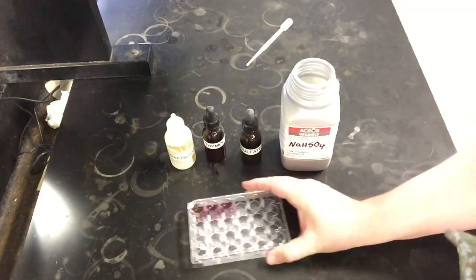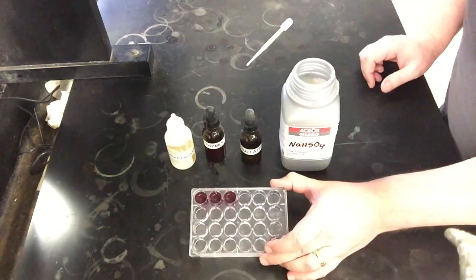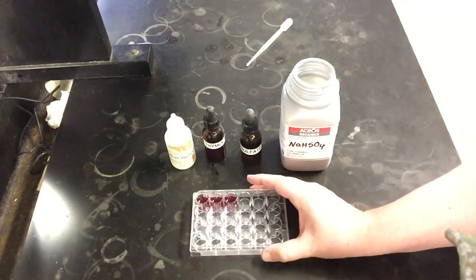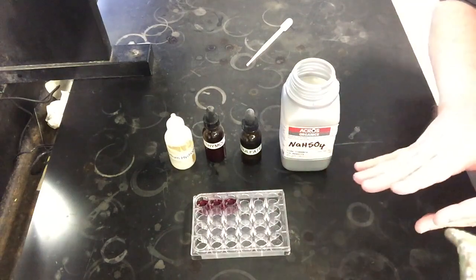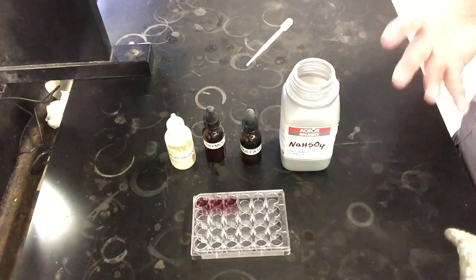It looks like it's actually staying kind of dark, so it's maybe slightly darker than we originally expected. Normally we'd expect a reddish orange color. Looks more like we have a red purple color. So it's pretty on the dark side right now, which is perfectly fine because we're really curious about color changes. The only thing that might come with this is that with any shift towards the product side, which is the more red side of this reaction with this particular indicator, we might not see much of a change.